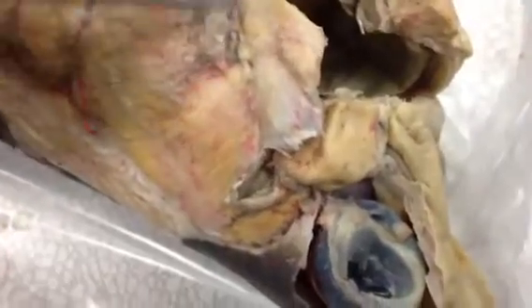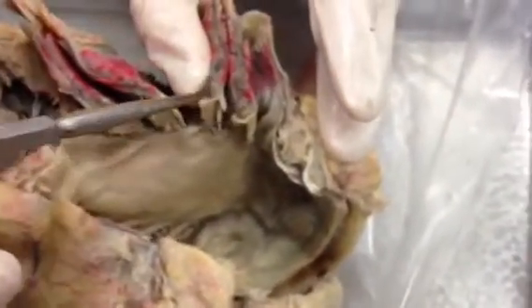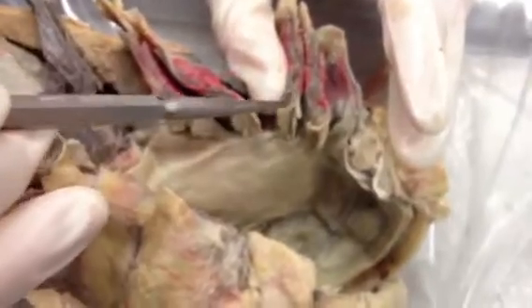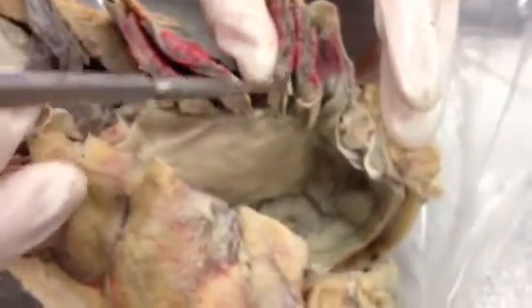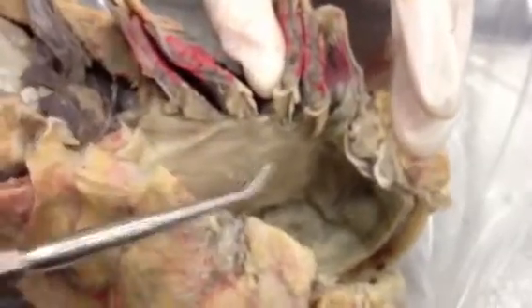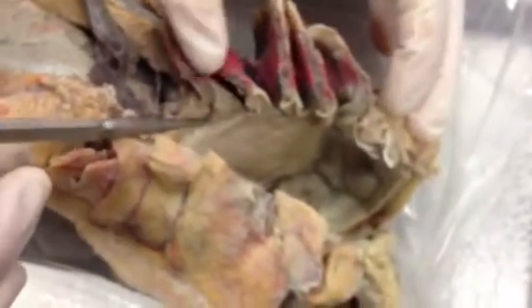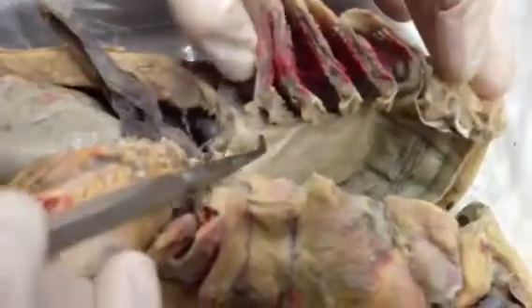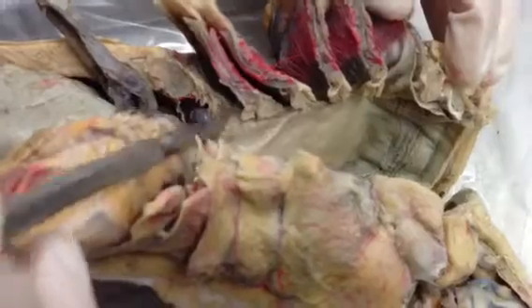In order to see the branchial arches, just know that those are the cartilages here. And depending on how the shark is cut, a branchial arch may be the ceratobranchial cartilage or it may be the epibranchial cartilage — it just depends on how it's cut. Each of these cartilages corresponds to a branchial arch: this would be the first, second, third, fourth, and fifth. These are all also part of the visceral arches.